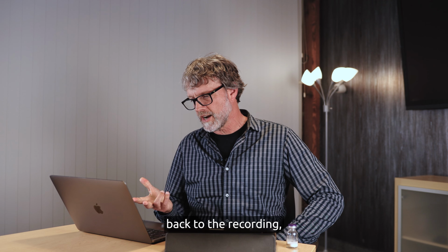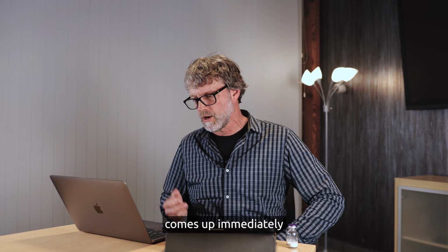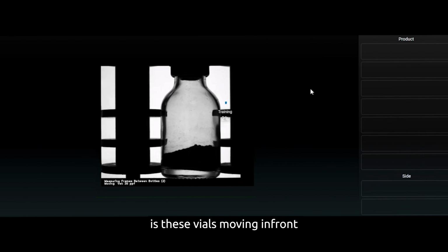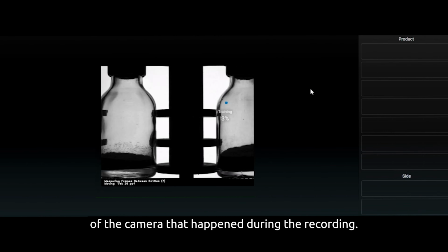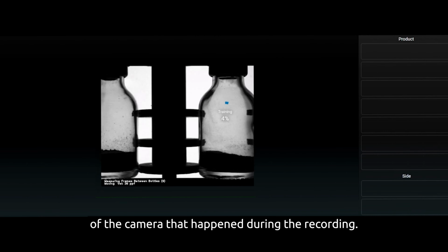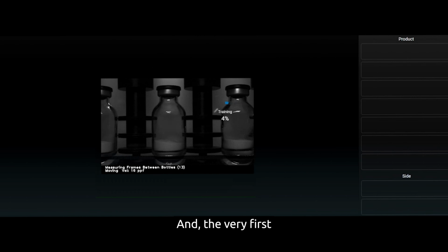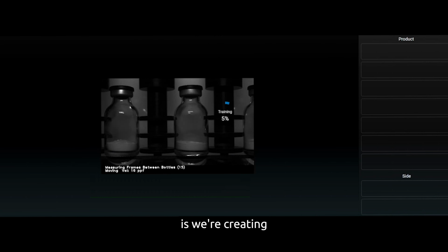Okay, now we're going to go back to the recording. This recording comes up immediately after we click Start Train. What you can see is these vials moving in front of the camera that happened during the recording. And the very first thing that we do is create a tracking model.